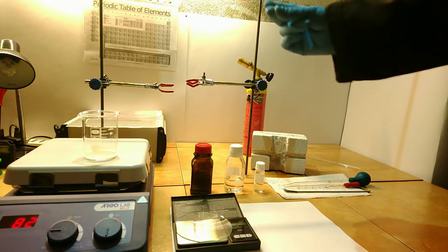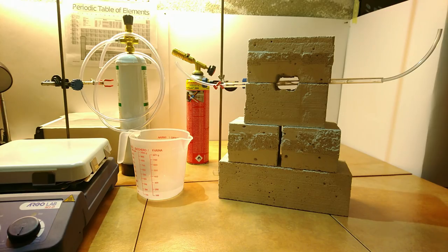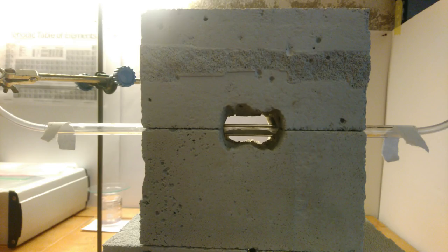Now let's make our furnace. See, I told you it was easy. By the magic of video editing the furnace is ready and the phosphor has been dried and loaded in the center of the tube.